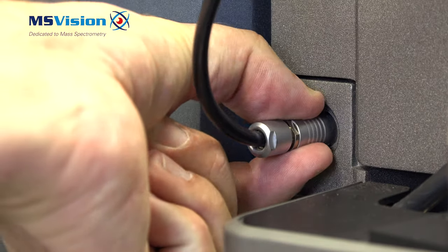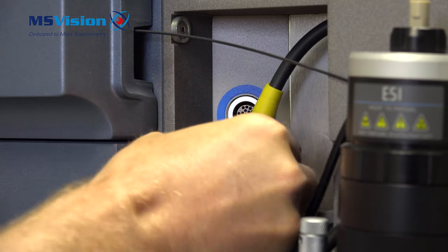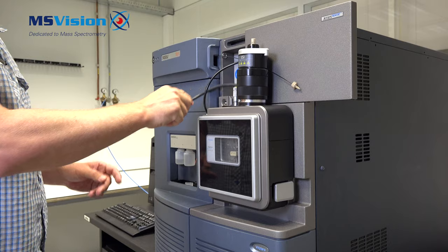Pull the collar at the rear so we can remove it, and the same for the larger one which is a tight fit. Let the cables hang downwards.